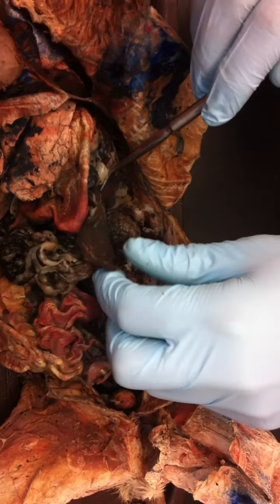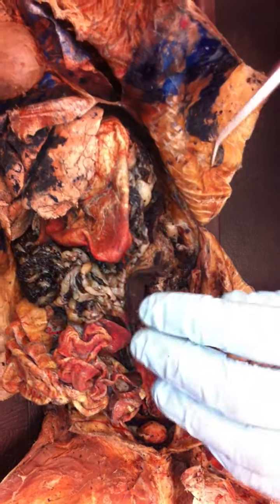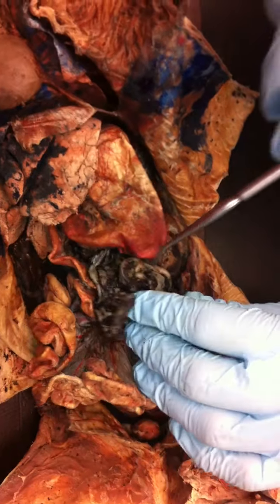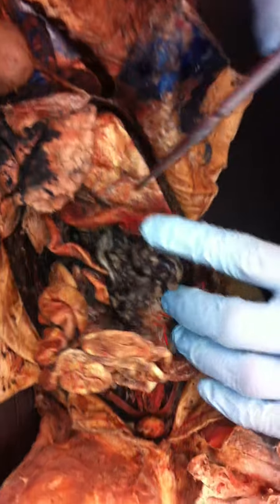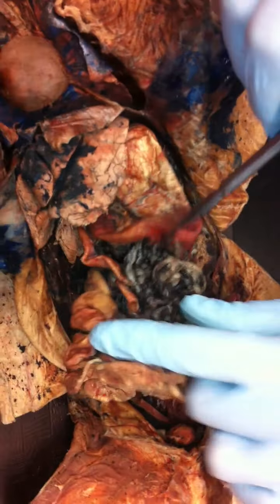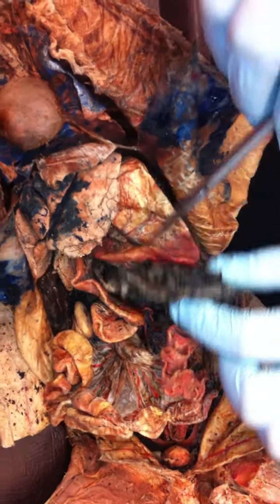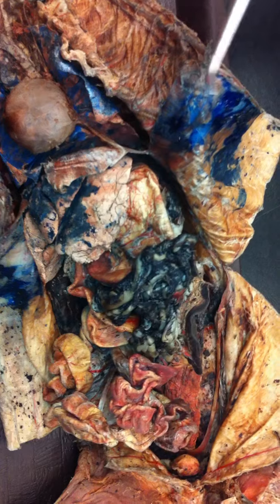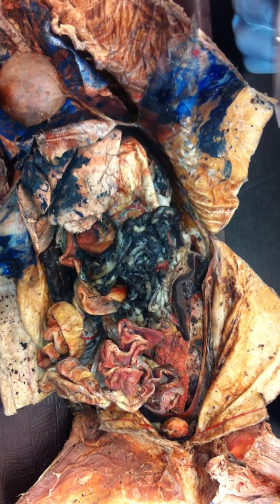My best guess is this is the spleen. Okay, the spleen's going to be on the left side. The brown thing? Yeah, the brown thing here. That's not on it. No, I'm not going to test you on it because I'm not 100% sure. And then the pancreas is usually, you said the big greasy one is what again? Greater omentum. Yeah. Okay. So the pancreas is usually somewhere underneath. But this is being pulled out and fallen apart so many times. Maybe this was over there. So it's hard to tell.